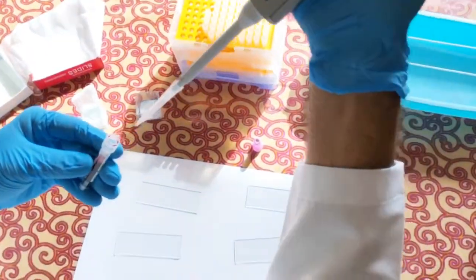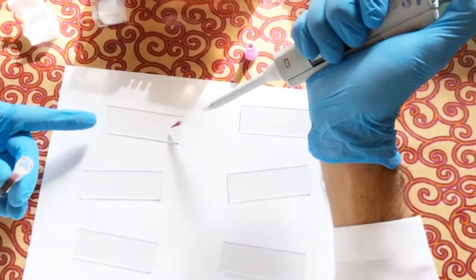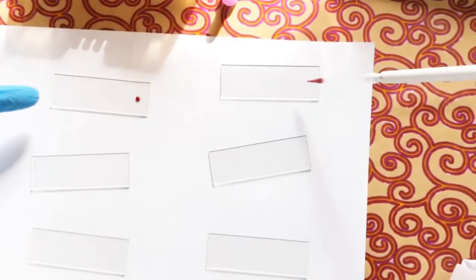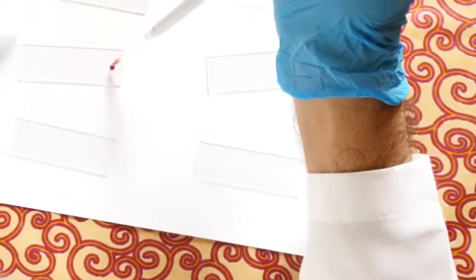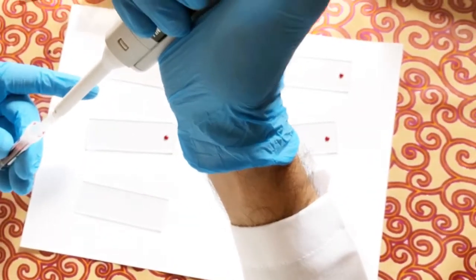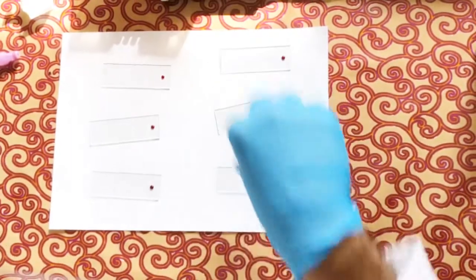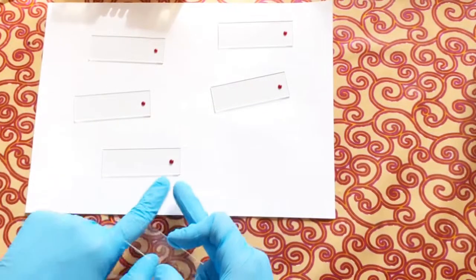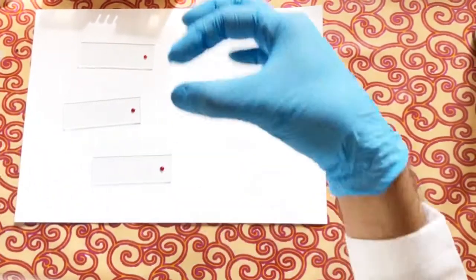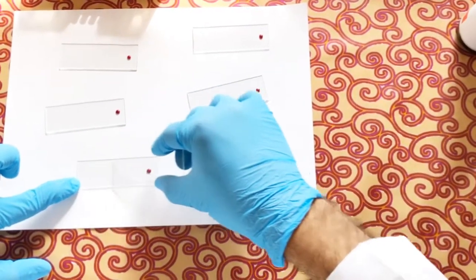Using a pipette, I aspirate a small drop of blood and place it on the slide — just this much. You can adjust the drop size according to requirements. Now let me show you the spreading technique as an example. With the drop at one end of the slide, I hold the slide firmly and position the spreader.